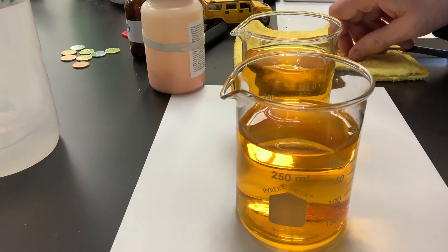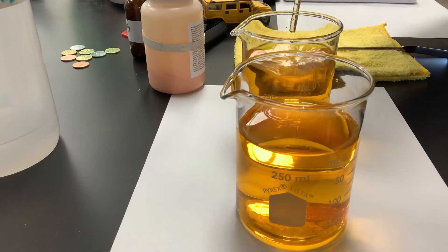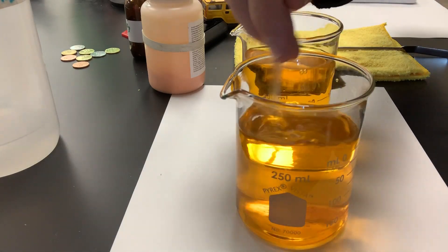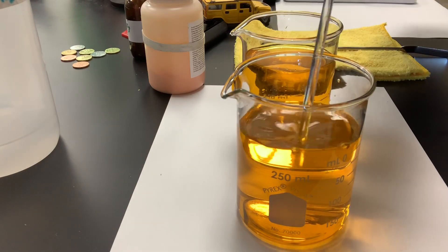Remember, solutions are homogenous mixtures. We'll stir each of these up to get all of the sodium dichromate to go into solution. All right, I think we've done it.